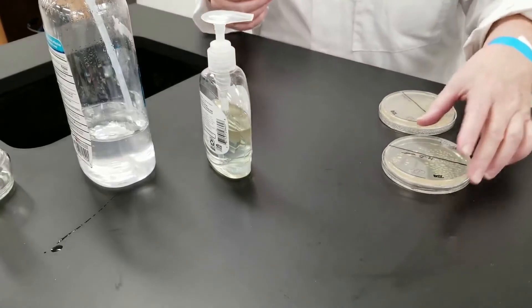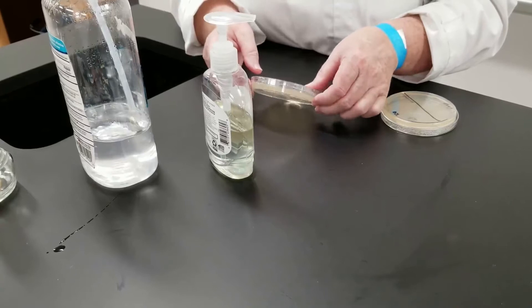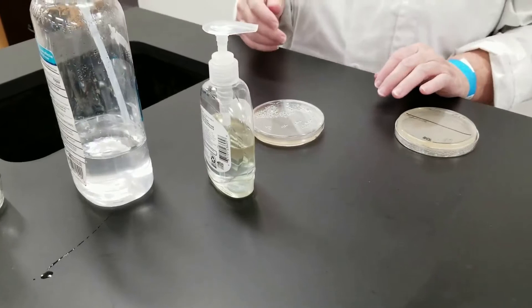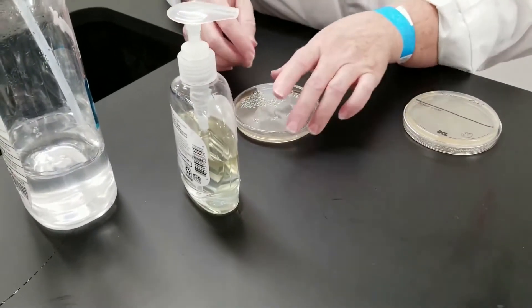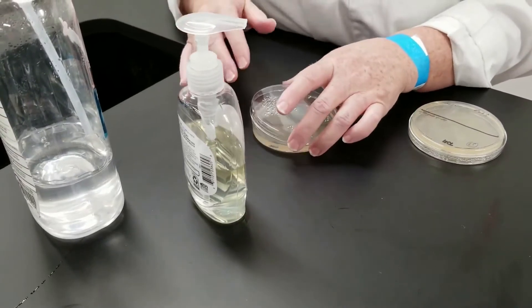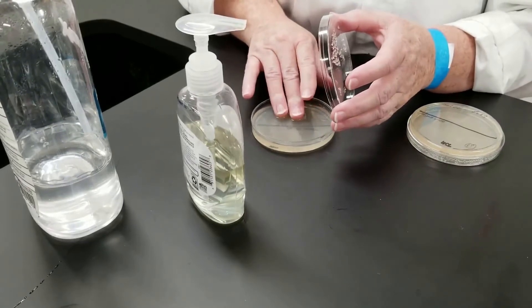The first thing we're going to do — these plates are just a general media, most anything will grow on them. You can see I have the plates divided in half. On this first plate, I'm just going to take a couple of my fingers and touch like this. After incubating, we'll find out what's on my hand.